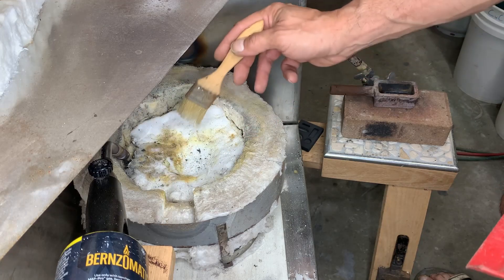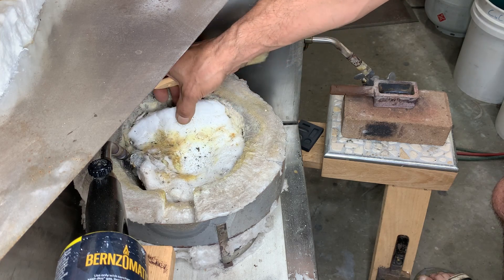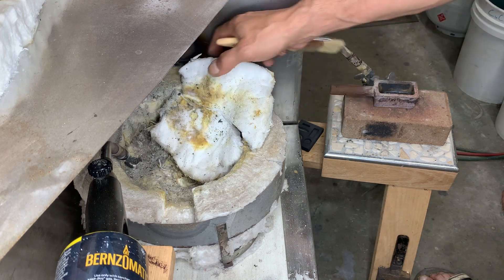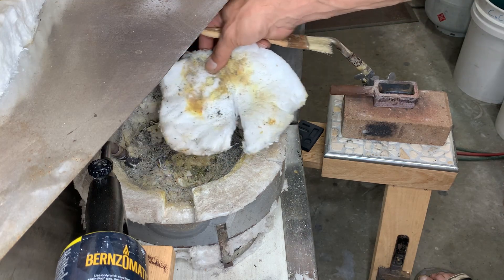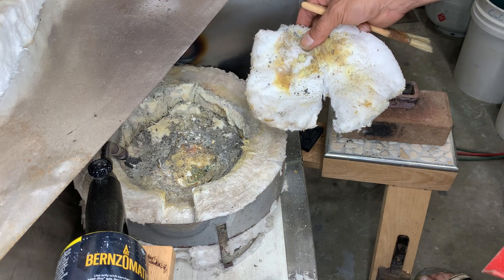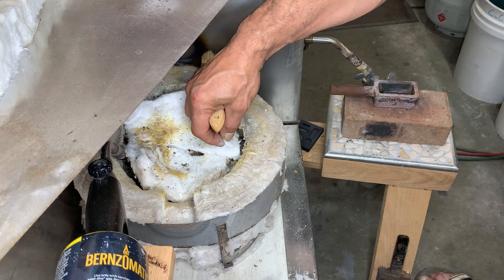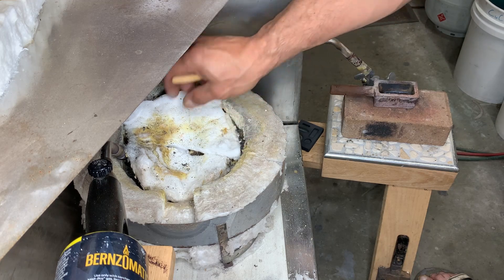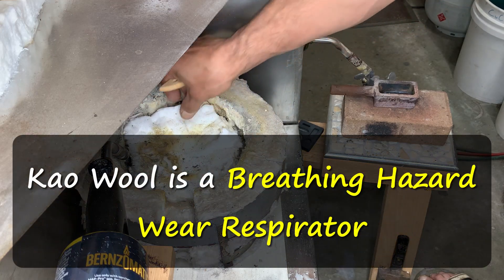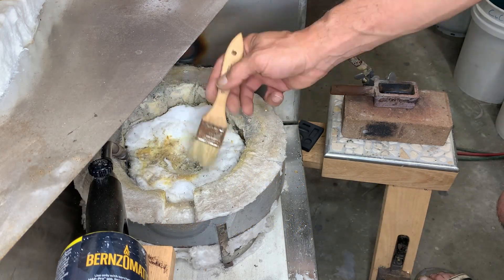Eventually I'll refine all of this kaowool. You can see even underneath this piece - I've added a second piece - the bottom layer ended up pretty caked with metal. There's quite a bit of metal in there, though it's mainly borax. The beauty of this kaowool is it kind of pulls off in sheets, similar to cotton - it'll peel back in layers. At the end when I'm ready to recover this metal that gets trapped inside the kaowool, we can put all of this in acid and recover our precious metals.